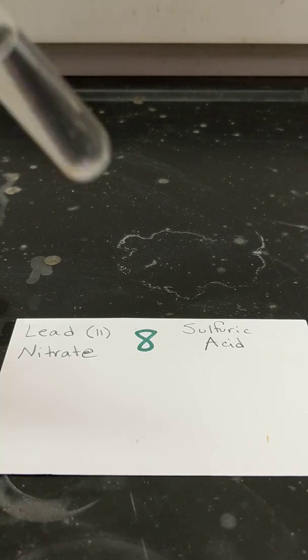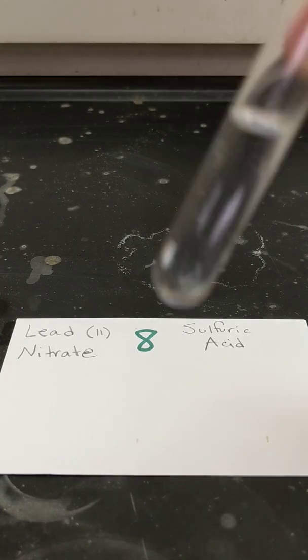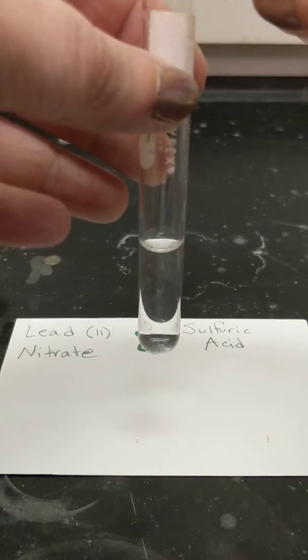Reaction 8, lead nitrate and sulfuric acid.